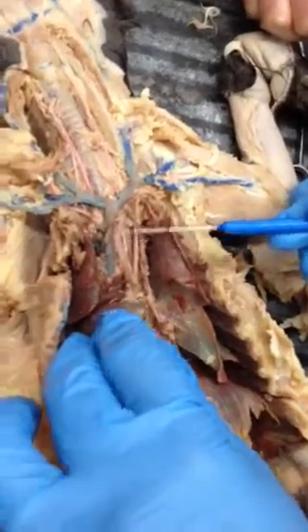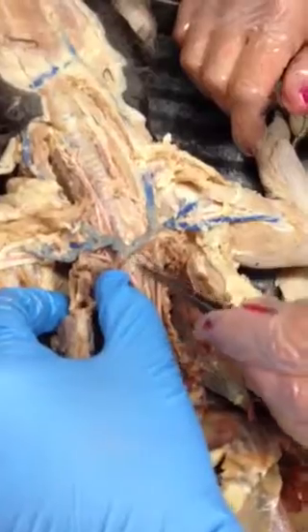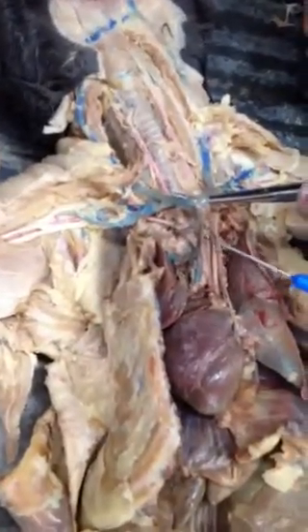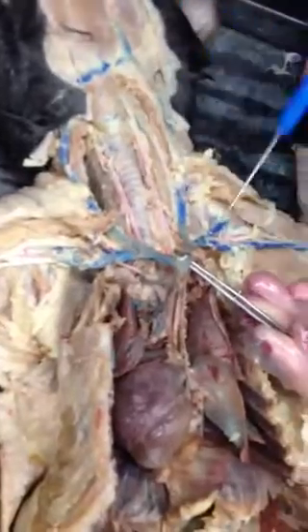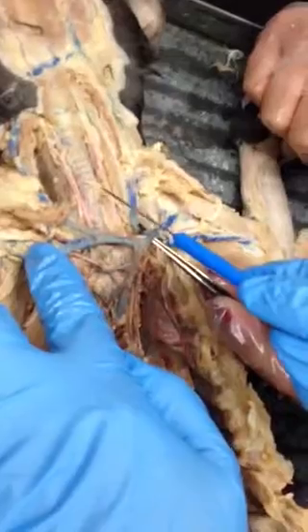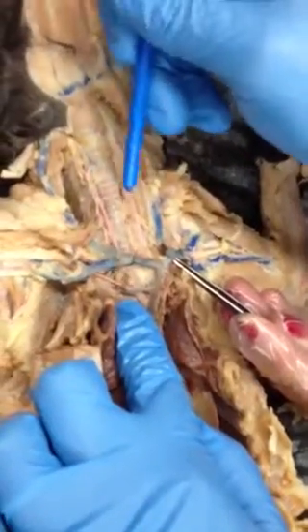The brachiocephalic is going to split. I have to move this out of the way so we can see some things that are going on under here. I don't want to cut it because we're going to talk about that next. So the first branch that comes off, if you follow it up, this is your left, anybody know? Common carotid. Common carotid artery. Yep. Then on the other side, it's going to branch off. The branch that goes up is going to be your right common carotid, and this side goes to the right subclavian artery.